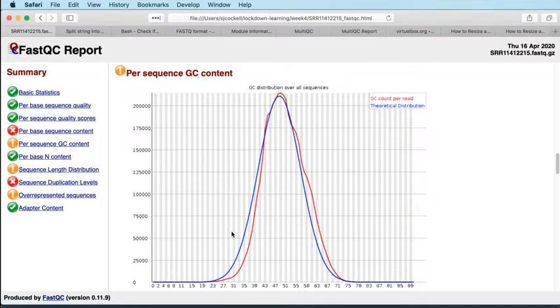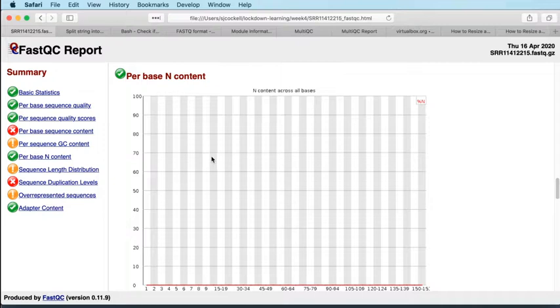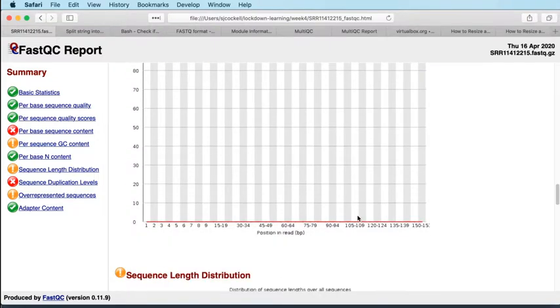So you wouldn't necessarily expect the observed distribution in your reads to match the theoretical distribution if we had one single value of GC content for our entire experiment. So again, although we've got a warning because we see slight deviations from the perfect blue curve, it's not significant enough to worry about, and it's not something to be concerned with anyway. Okay, per base N content. If you had particular cycles in your sequencer that failed, you may see spikes at particular positions, which would be cause for concern, and we don't see that here. So this is fine, and we can proceed with this.